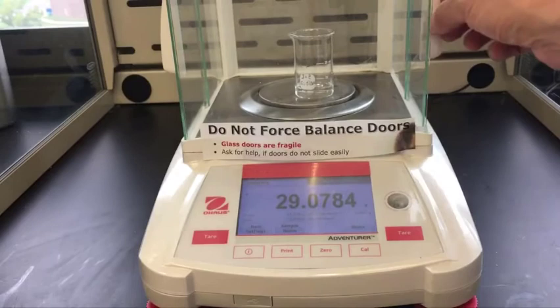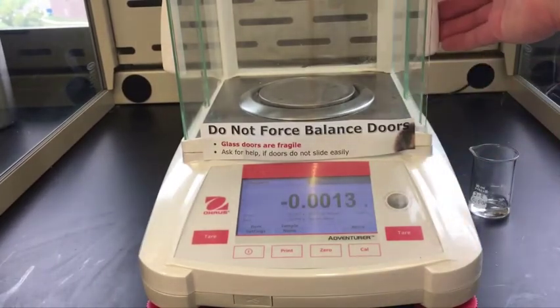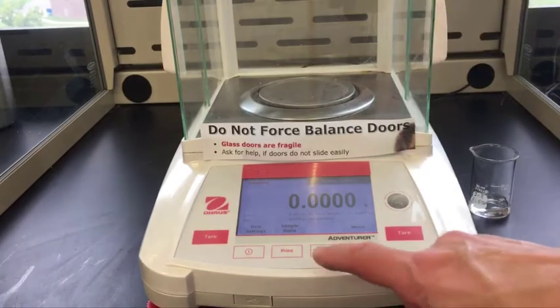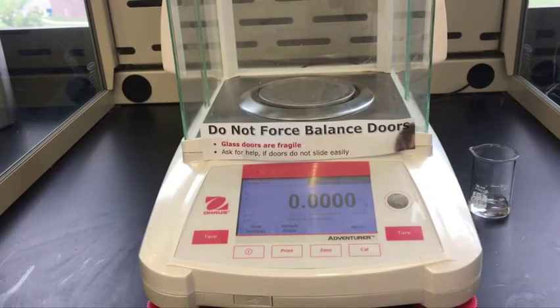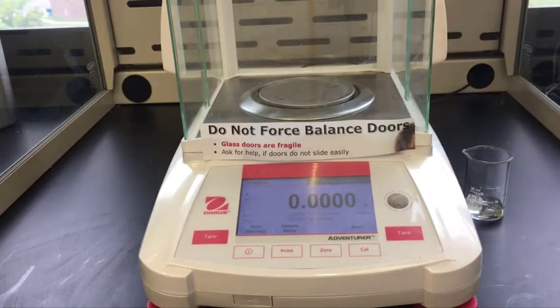Once I'm done recording the mass, take the beaker off of the pan, close the door, always zero it for the next person. Now that I have the mass of the beaker with the water, I determined the mass of the empty beaker earlier. Subtract the two, I get the mass of the water, and I know the volume of the water, so now I can calculate the density.